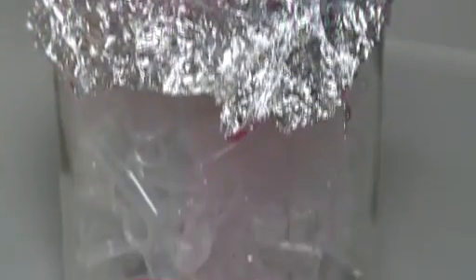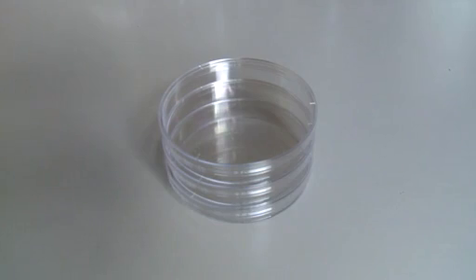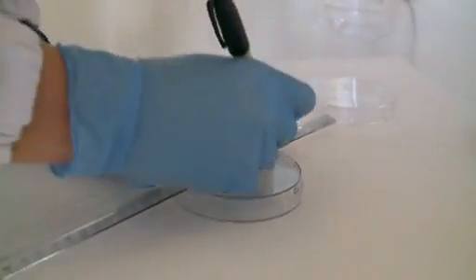1.5 ml tubes for serial dilution of bacterial suspensions. 90 mm diameter petri dishes to plate bacteria.